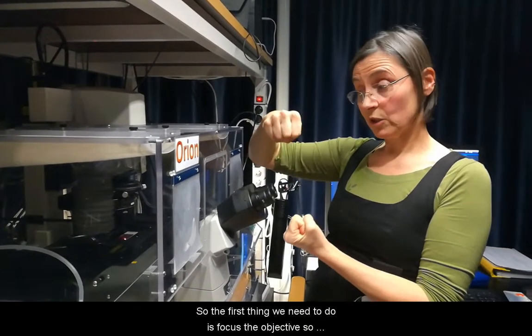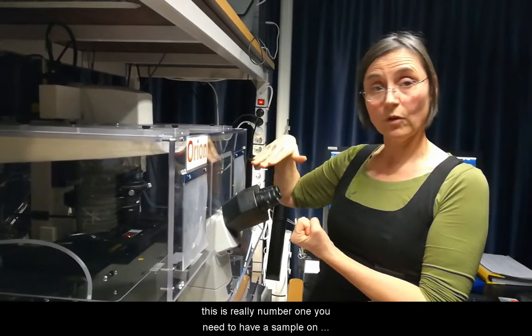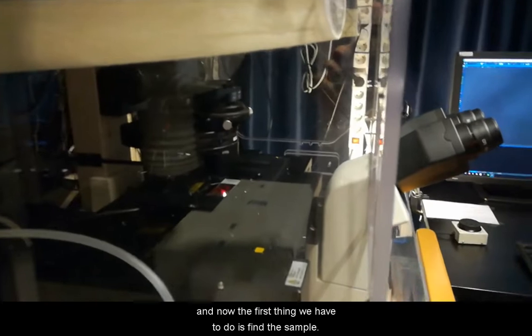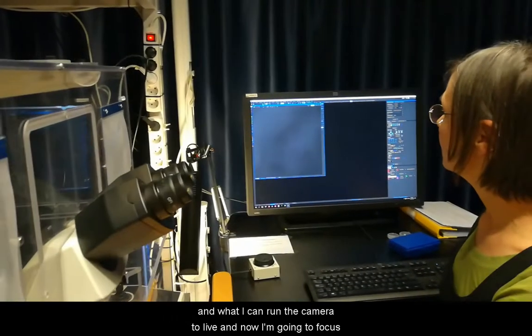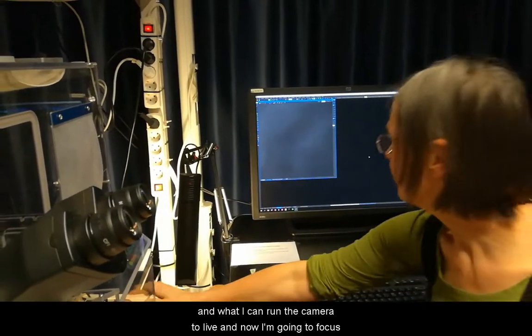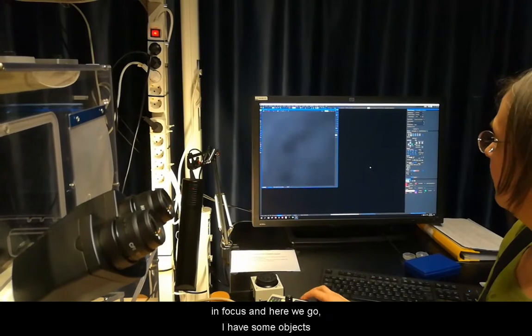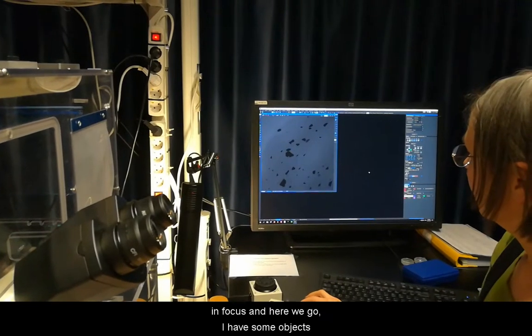The first thing we need to do is focus the objective. So number one: you need to have a sample on your stage. We have a sample now — I don't know what it is, but something. The first thing we have to do is find the sample. I have an image on the screen, I can run the camera to live, and now I'm going to focus so that I can get my image in focus. Here we go, we have something — some sort of objects.